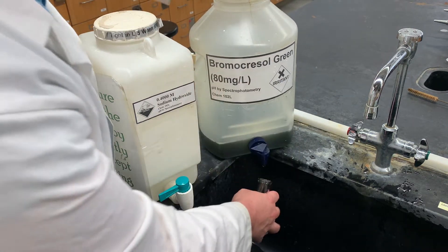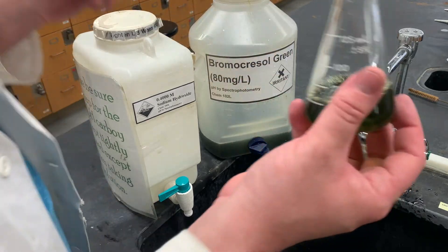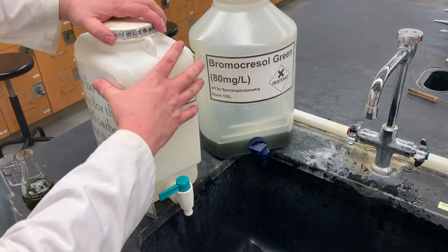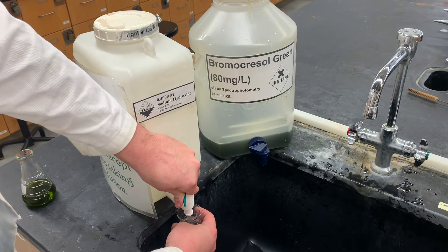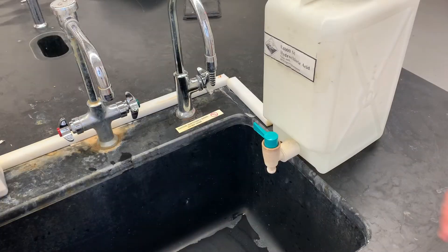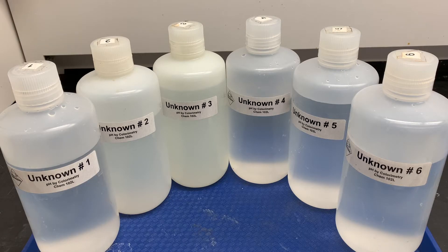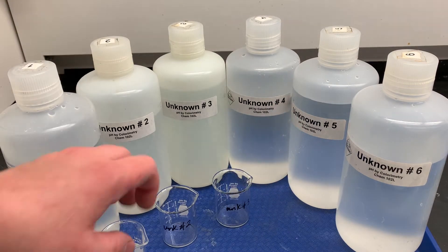Make sure the cap is just a little open so you can actually take what you need. It's a lovely, disgusting color of green. And some of the sodium hydroxide. Grab some of our hydrochloric acid as well. And then each of the unknowns you're assigned — I'm going to do one, two, and three.